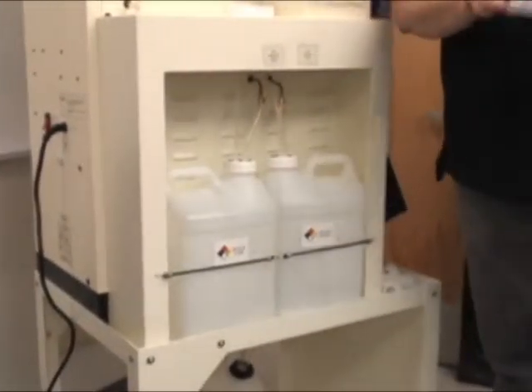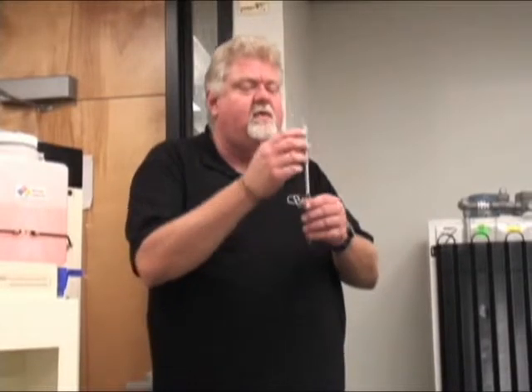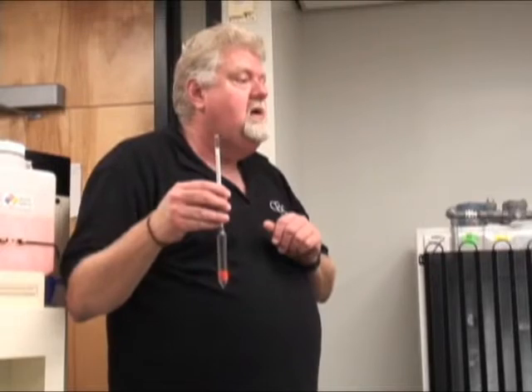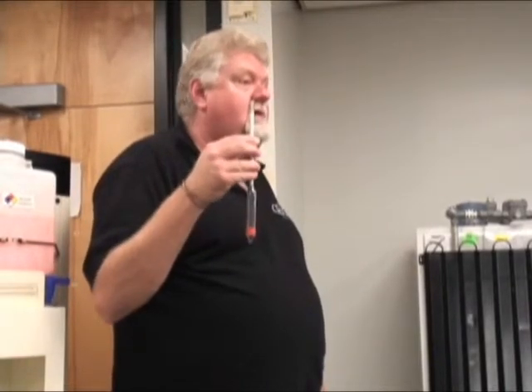How do you know what that container holds? We've given you a new hydrometer. For those of you who don't use a hydrometer, I'll explain it quickly. This is a standard hydrometer — specific gravity. What you would do is have a graduated cylinder, about a 500 ml graduated glass cylinder, and put in about three quarters of the alcohol you've got back from this system. You have graduations — you have 100 proof and on down, and on one side there's 200 proof for labs that use 200 proof alcohol. Simply set this inside the graduated cylinder, let it float at the meniscus line, and read exactly what your concentration of alcohol is. It works very well, and it can't lie to you. If it says it's 95% alcohol, it is 95% clean, clear, sterile alcohol.